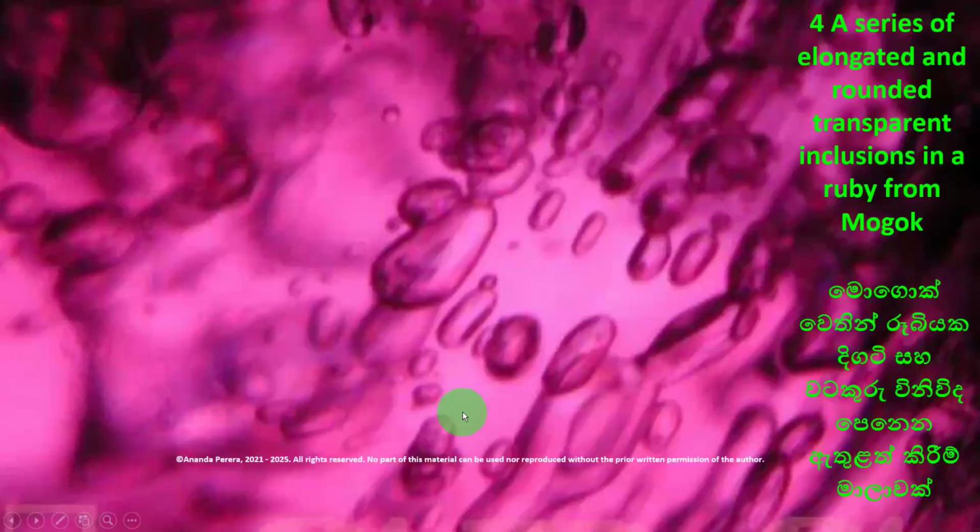And look at the first one. Two-phase inclusions here. Liquid and gas inclusions here. But here, it is solid inclusions. This is a solid inclusion in an unheated Mogok ruby.